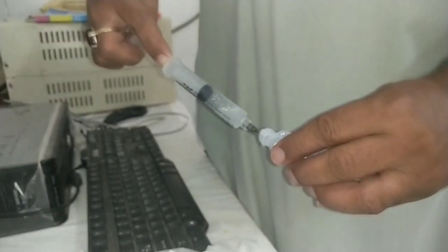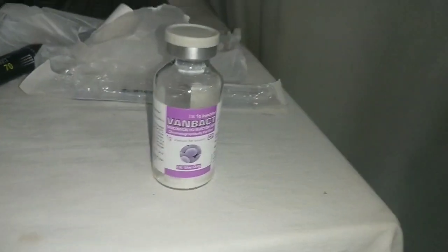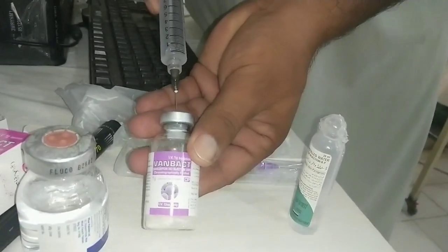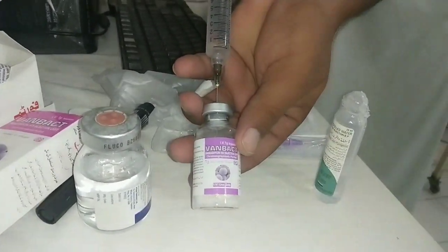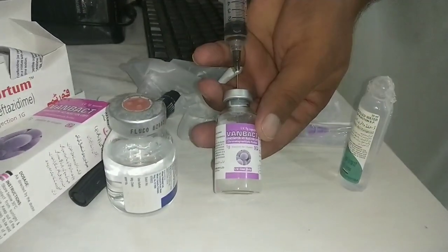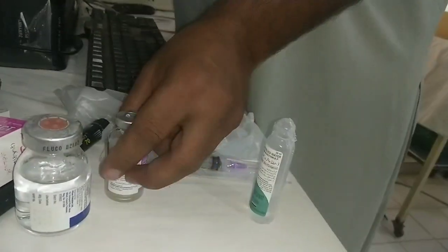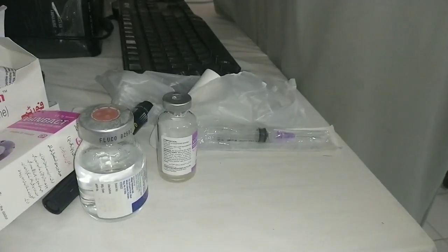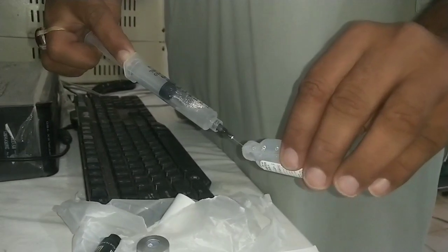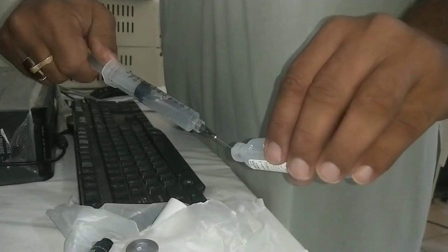We should know how to prepare these from injectable forms. First, vancomycin, ceftazidime, and cefazolin for topical use — they are needed at 50 milligram per ml, or 5% dose. So if using a 500 mg injection, put 10 ml distilled water; if using a 1 gram injection, put 20 ml distilled water and it is ready for topical use. Use disposable syringes and make these under sterile aseptic conditions in the OT, under a laminar airflow hood.